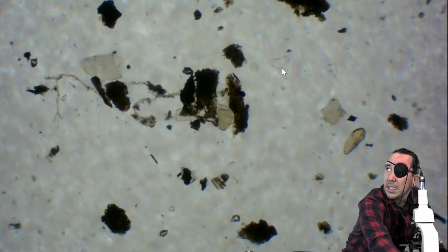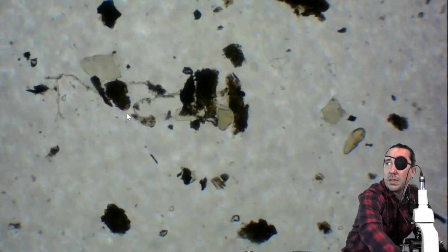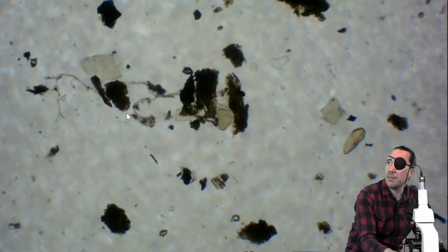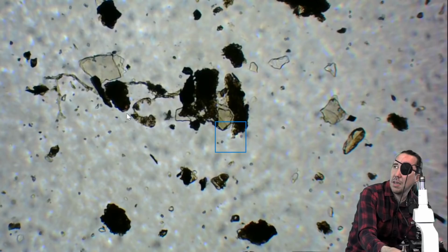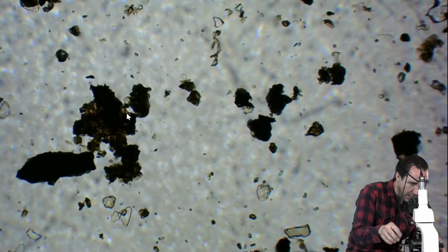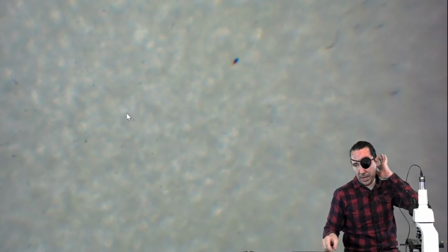Pieces like this that are clear and jagged are going to be minerals in the soil. Looks like probably this one here too. That aggregate right where the mouse is moving a little bit tells me that there might be a flagellate underneath that. Otherwise, it's just me bumping the table. I think it's just me bumping the table. Is that the worm compost? None of it's worm compost. Okay, I'm going to stick another drop on here, a fresh drop.